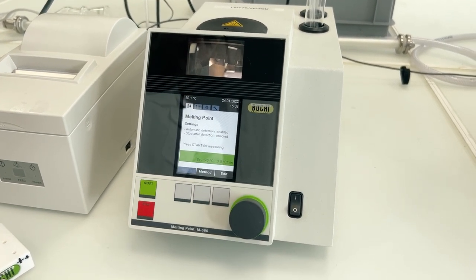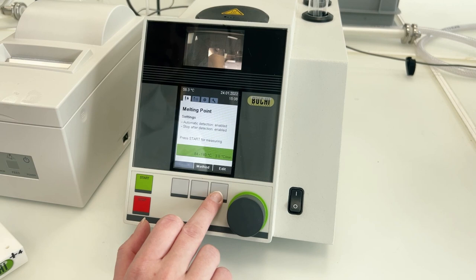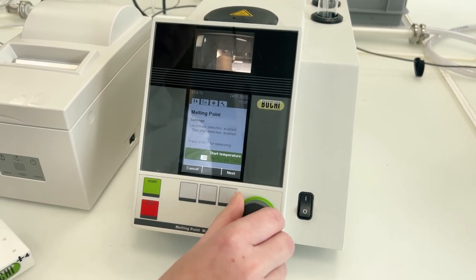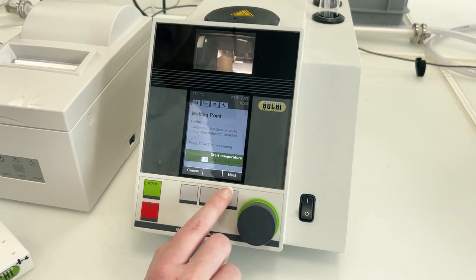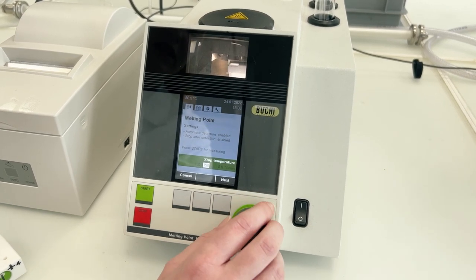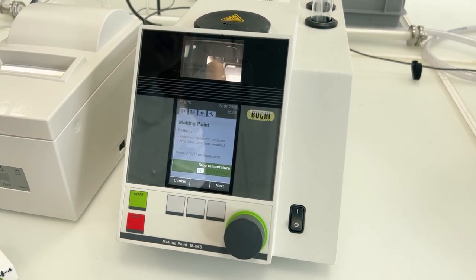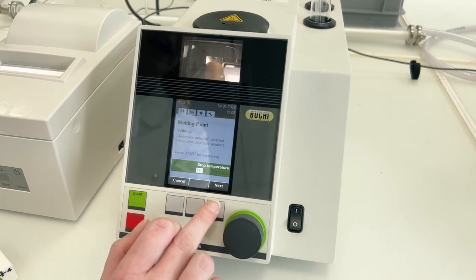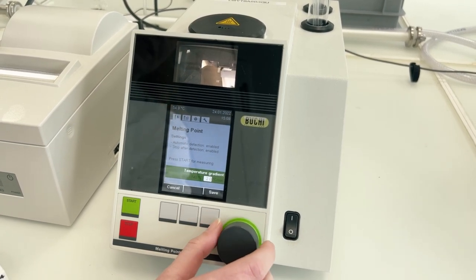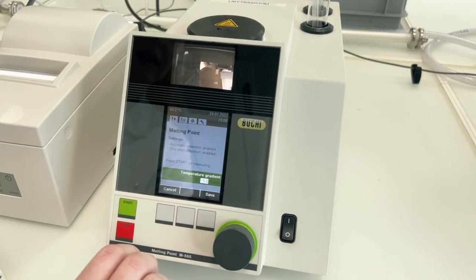For my sample I know the melting point is around 111 degrees Celsius. I'll edit the method and set the start temperature to about five degrees below that — so 105°C. The end temperature I'll set to 140°C. The device actually stops automatically when the clear point is detected, so it may not reach that high. A gradient of three degrees per minute is a little too high, so for the first run I always use one degree Celsius per minute. Now I'll save those settings.